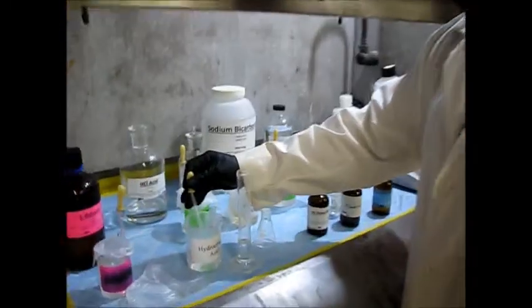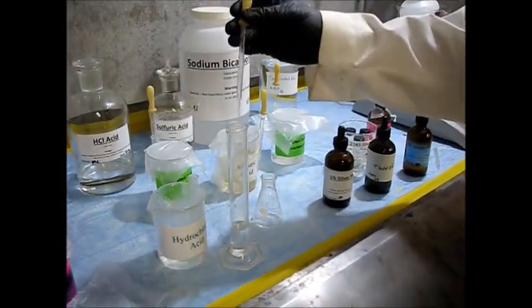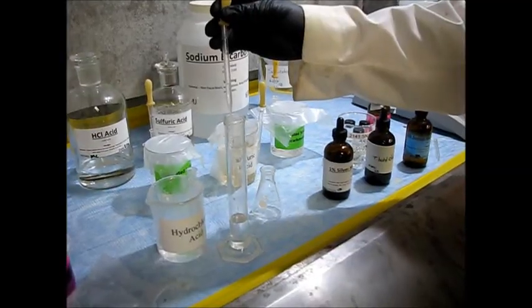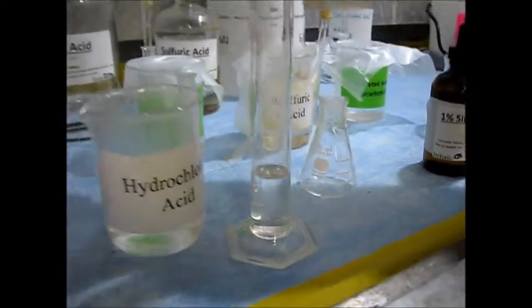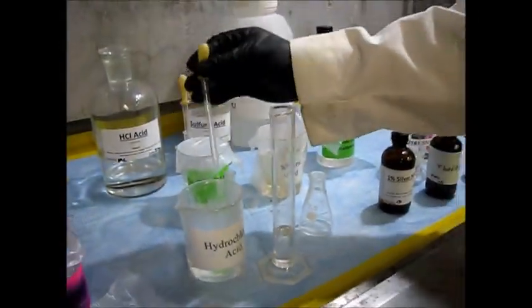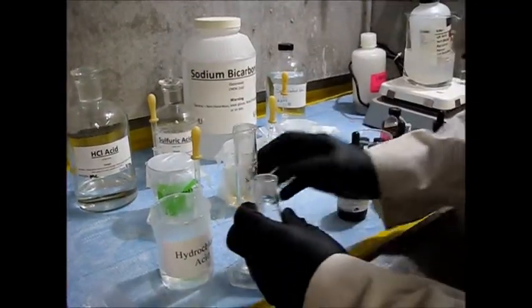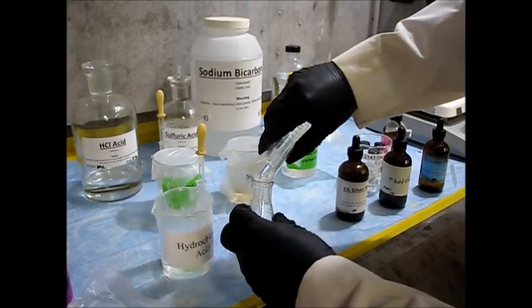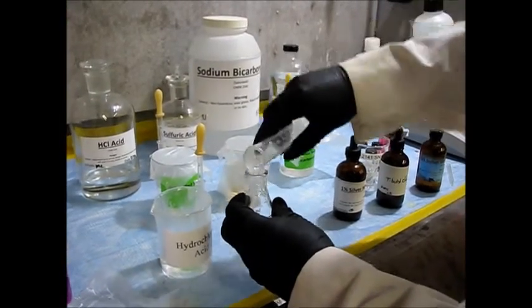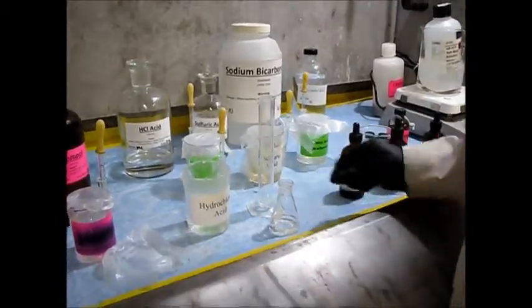To start the SN1 reaction, take the hydrochloric acid and use your pipette to transfer it into a large graduated cylinder. Let it drop down the side so it doesn't splash, and once you reach 15 milliliters, carefully pour it from the graduated cylinder into your Erlenmeyer flask. Now we need to cool it on the ice bath.